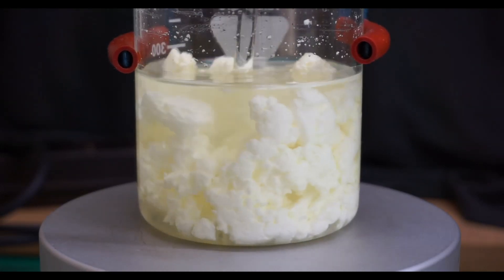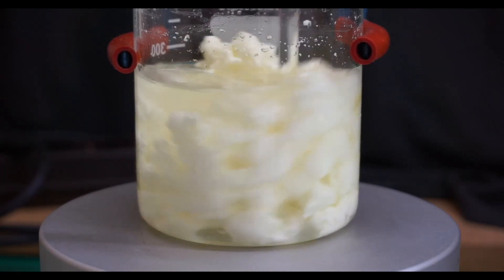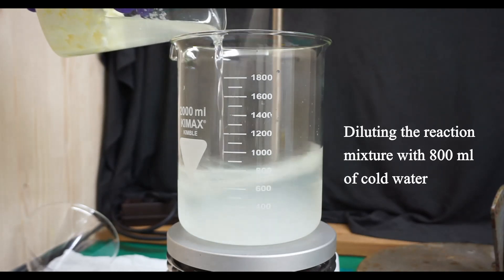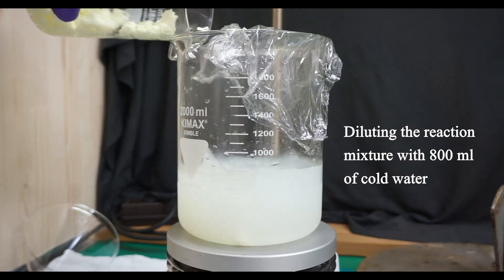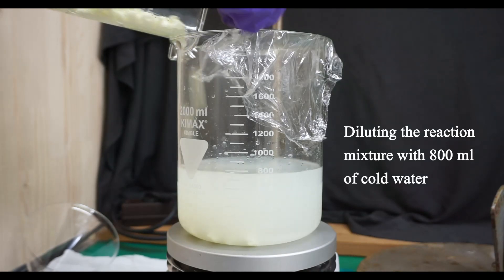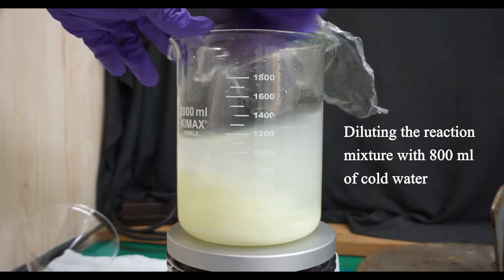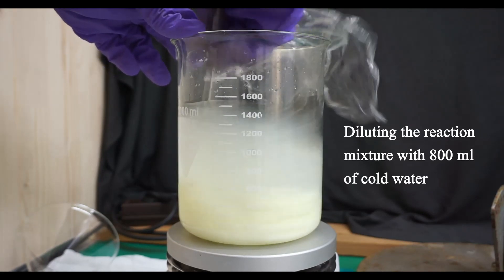I covered the beaker with plastic wrap and left this mixture to stand overnight at room temperature. The next day, I poured the reaction mixture into approximately 550 ml of water and then washed the beaker with another 250 ml of water. I stirred the suspension with a glass rod for about a minute and then proceeded to filter it.